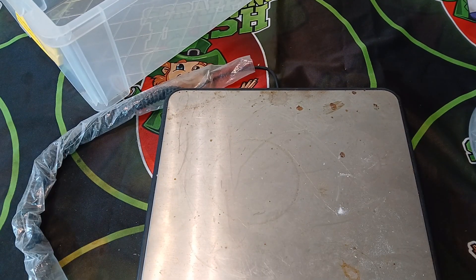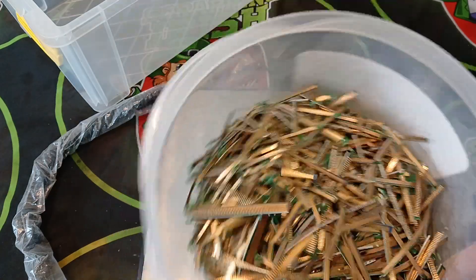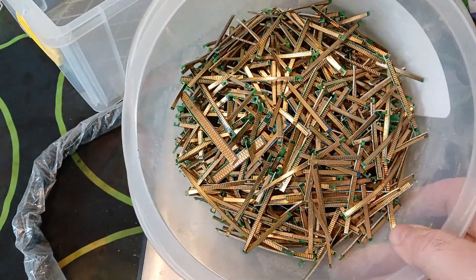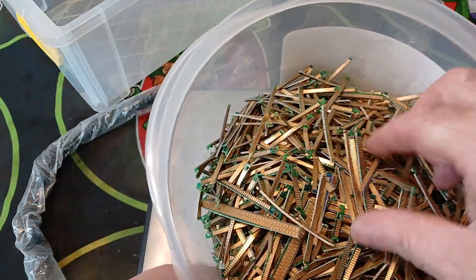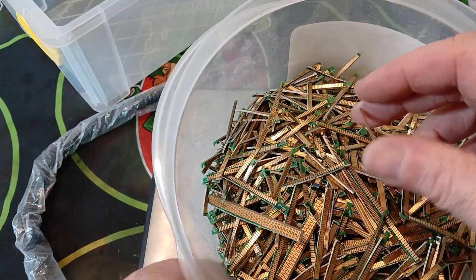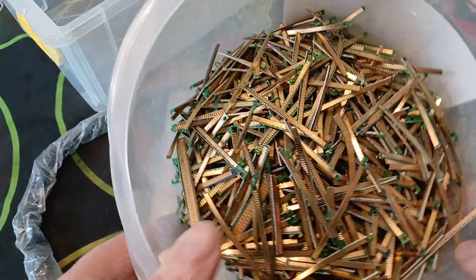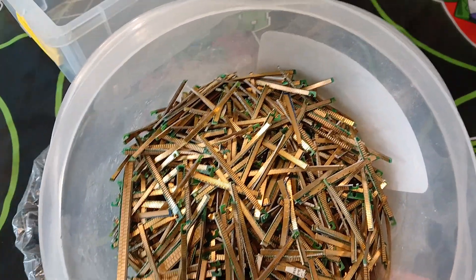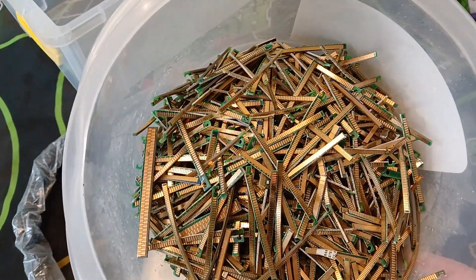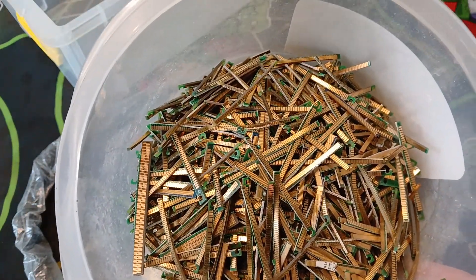Welcome back. I'm working on some RAM fingers that I've trimmed — I've done this loads of times but just showing what I'm up to. For anyone new to the channel, these are RAM fingers I got from around — some are mine, others are mixed in. We're going to be working on them, putting them into copper chloride to start. This video will hopefully go right from getting the gold off, filtering, dissolving, and getting the gold powder at the end.